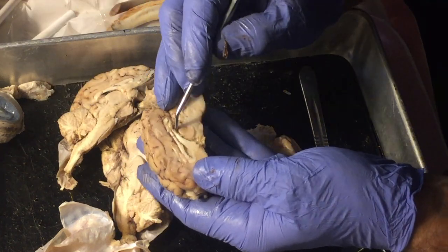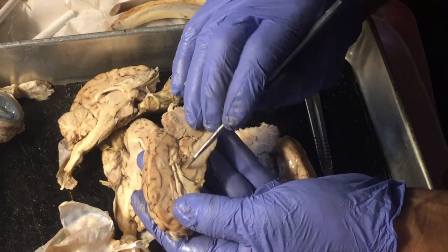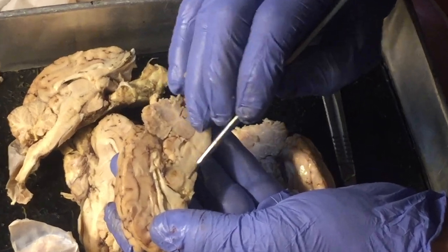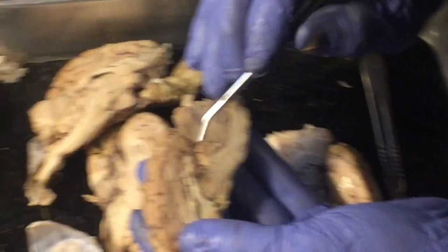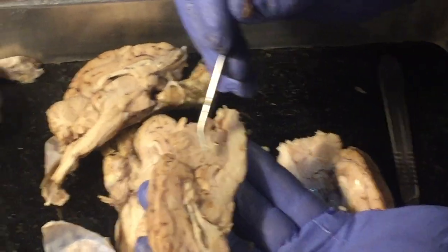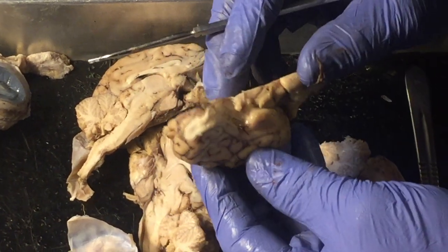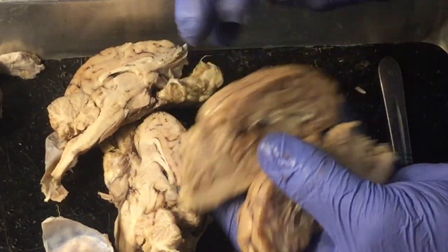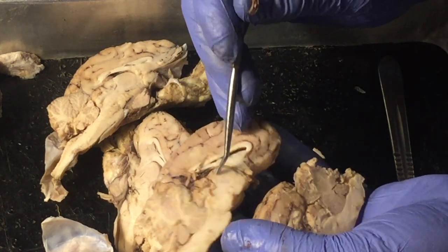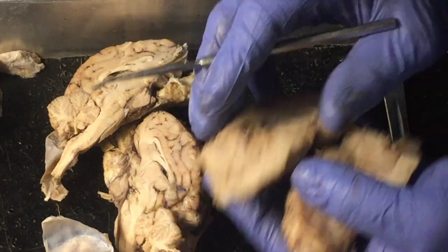Yeah, not bad. Shows the lateral ventricle, first or second ventricle, really well. The thalamus, and here shows up the third ventricle just a little bit better right down here. So the thalamus, the third ventricle, the pineal gland, not quite as good. Pons and medulla oblongata, here's the cerebellum, shows up pretty good. And of course the cerebrum here, corpus callosum. And how about this side? Pretty much the same. Thalamus, yep. All right, why don't you pause it, Beck?